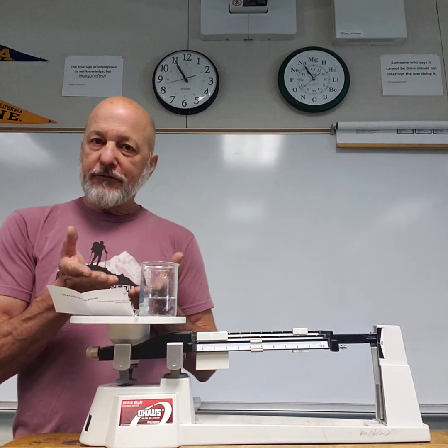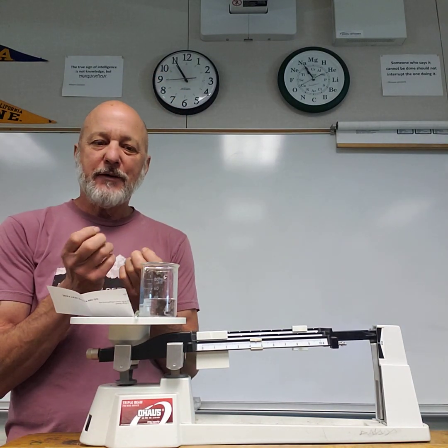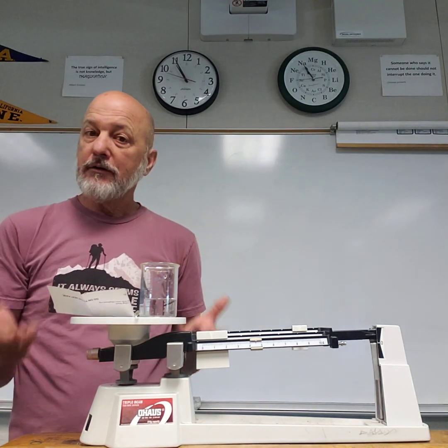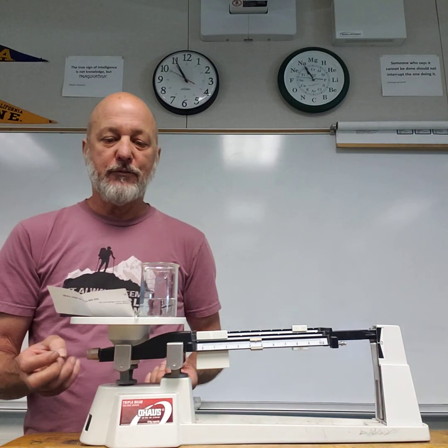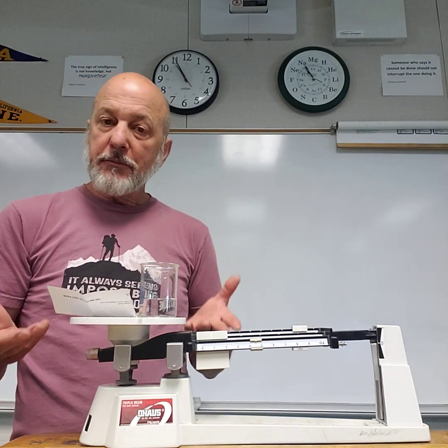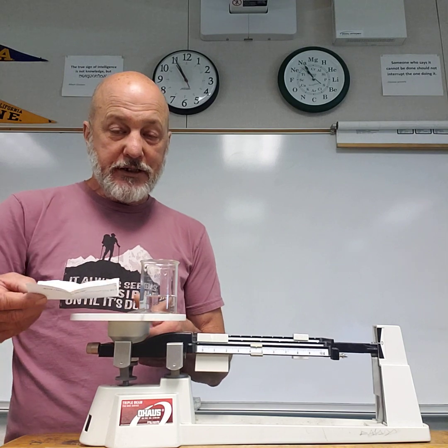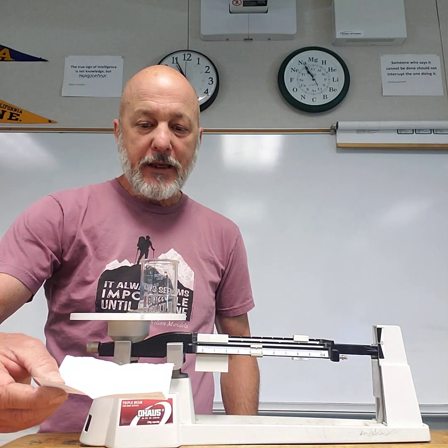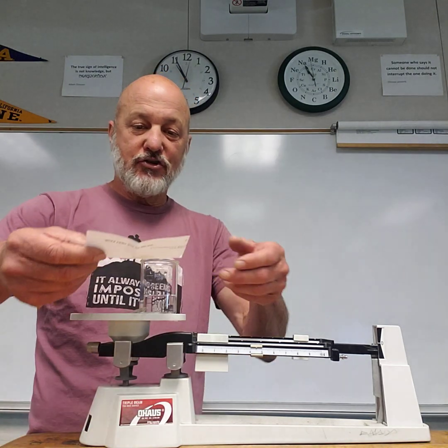I'm weighing the stir rod for a reason, and part 1 of the lab where you're breaking up the steel wool, you say, well, there should be no change of mass, and if you lost some mass, you could maybe account for why you did. We'll talk about that. You get your mass, and then what am I going to do? I'm going to take this sugar that's in this thing, a little hard to see, and I'm going to magically make this sugar disappear.